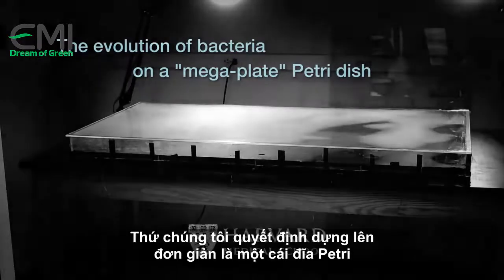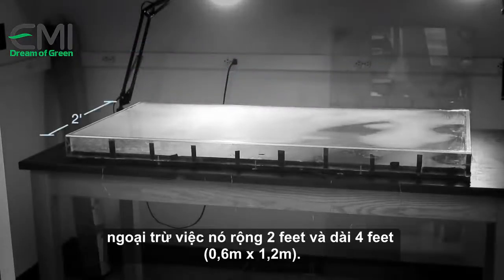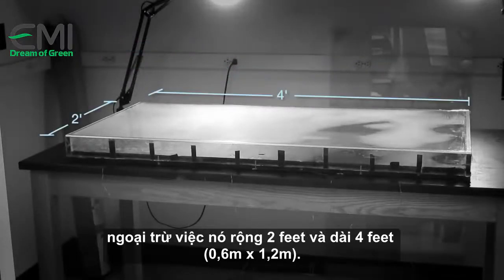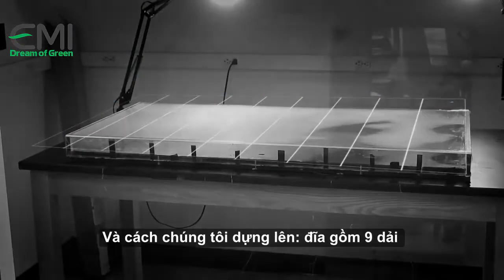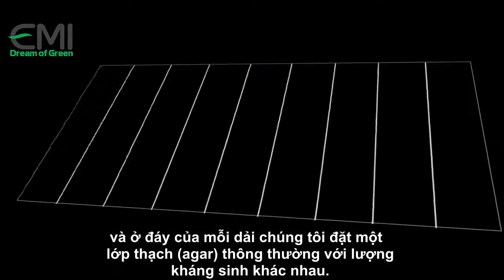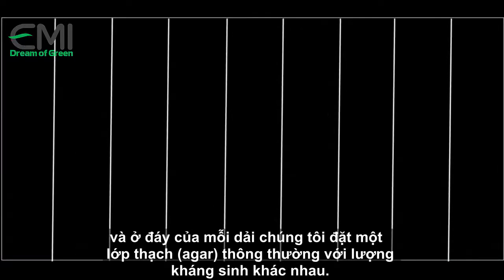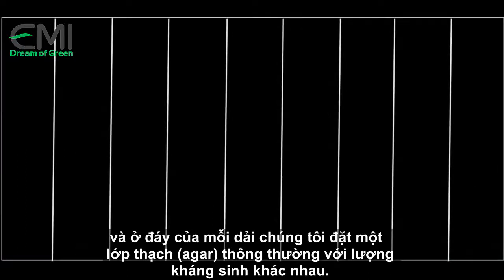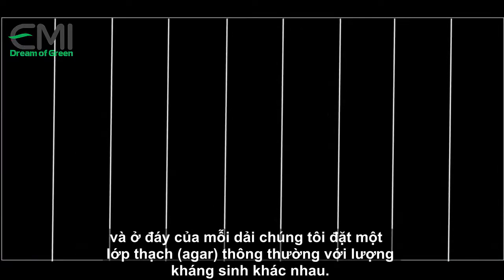What we ended up building was basically a petri dish, except that it's two feet by four feet. The way we set it up is that there are nine bands, and at the base of each of these bands, we put a normal petri dish thick agar with different amounts of antibiotic.